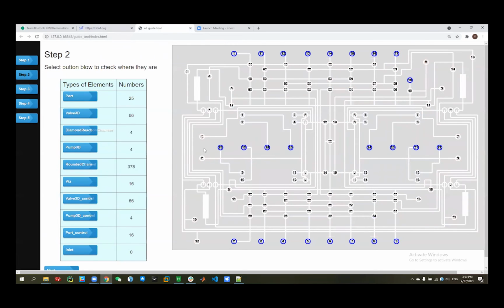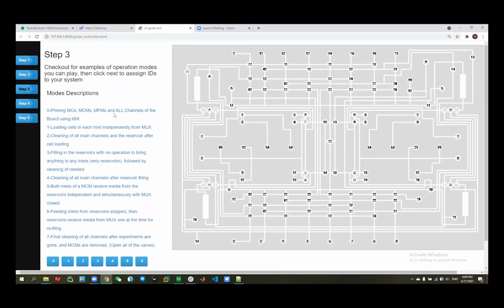We need to determine which ports are inlet. Because that can help us to do the logic error detection in the step 4 for the simulation function. So here we choose 1, 11, and 12 as our inlet, and all of the left ports will be viewed as outlet. And we can see it by double clicking it. So okay, we can go to the step 3.